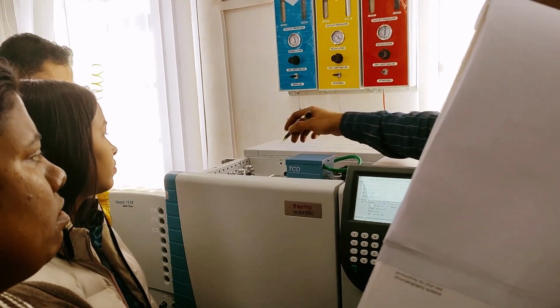Okay, for the flame? No, we have to give hydrogen. So hydrogen and zero air is the fuel for the FID. That's why we are using this. All are connected.